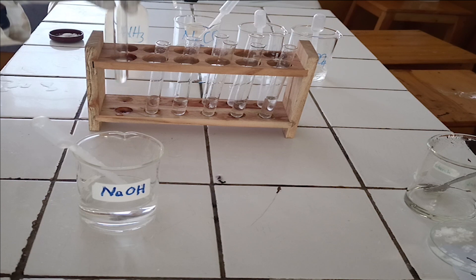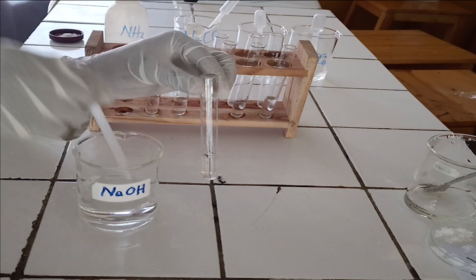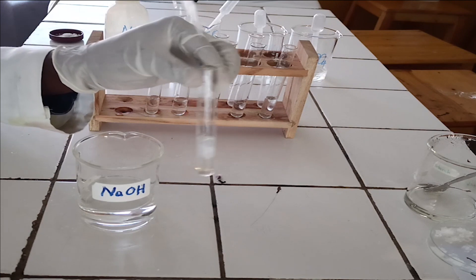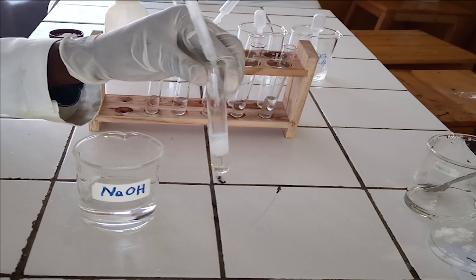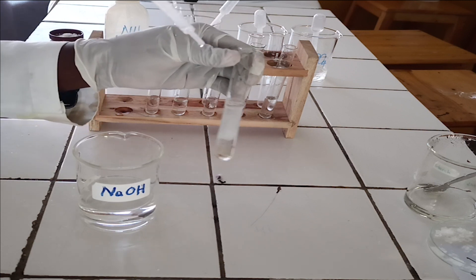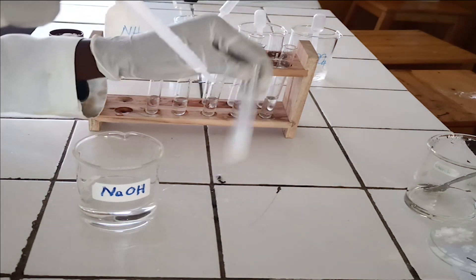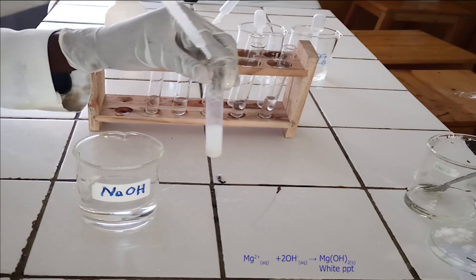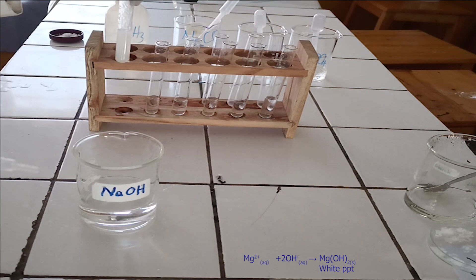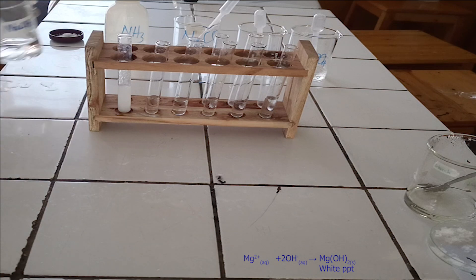To the first test tube, add sodium hydroxide solution dropwise until in excess. As you see, sodium hydroxide reacts with magnesium ion to form a white precipitate, which is insoluble in excess of sodium hydroxide. Below, there is the ionic equation for this reaction.